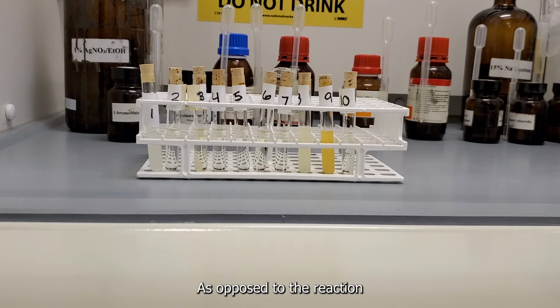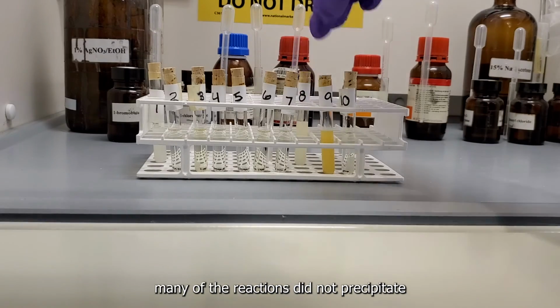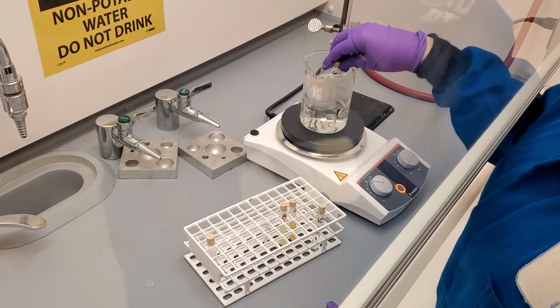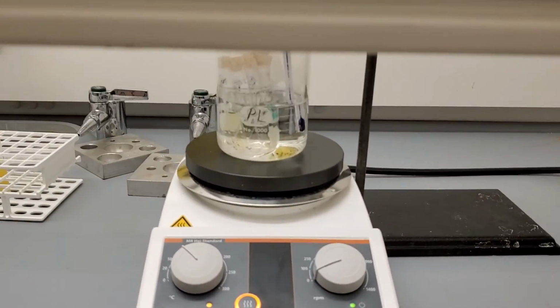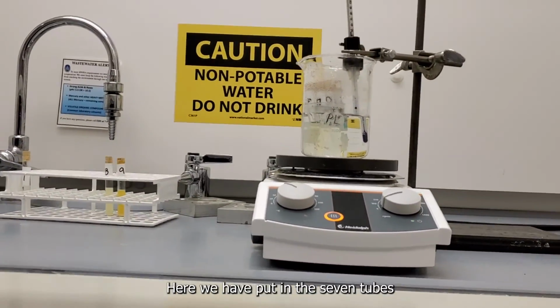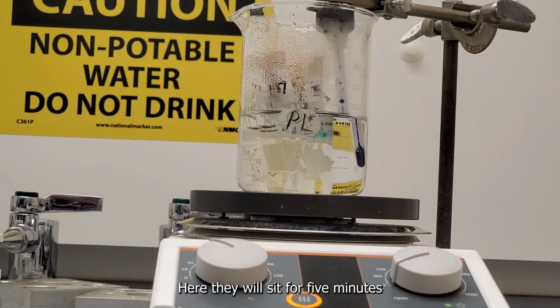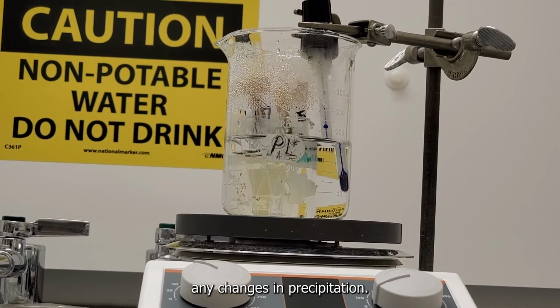As opposed to the reaction in ethanolic silver nitrate, in this one many of the reactions did not precipitate in the 10-minute period, so we will move on to the water bath. Here we have put in the 7 tubes that showed very little precipitation. Here they will sit for 5 minutes before we take them out and observe any changes in precipitation.